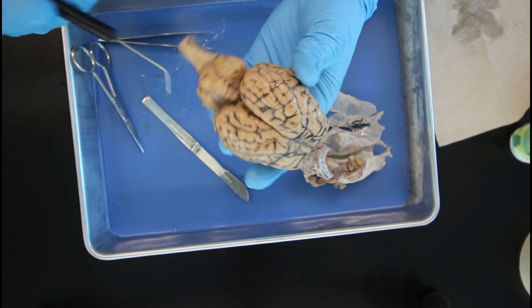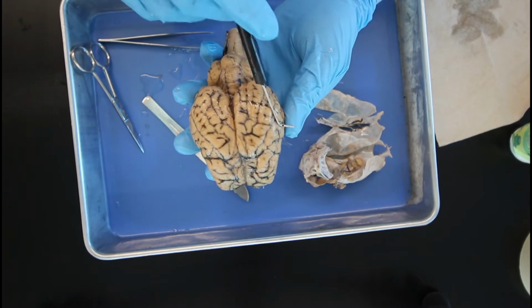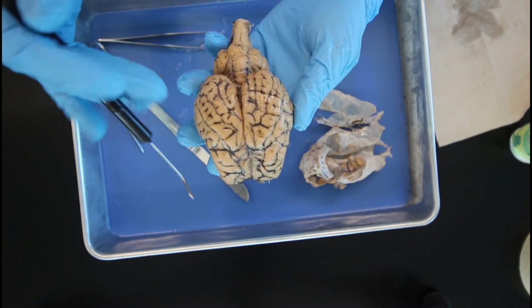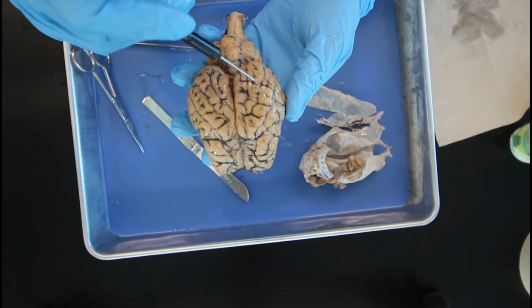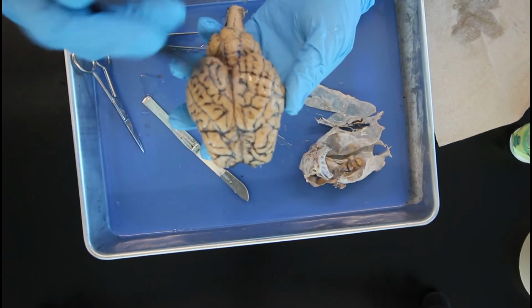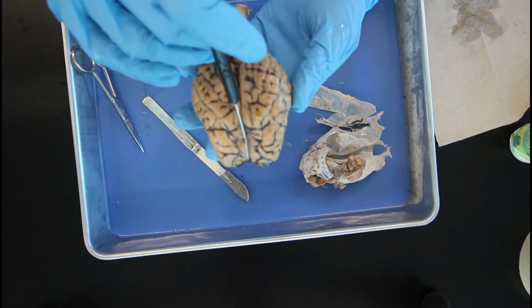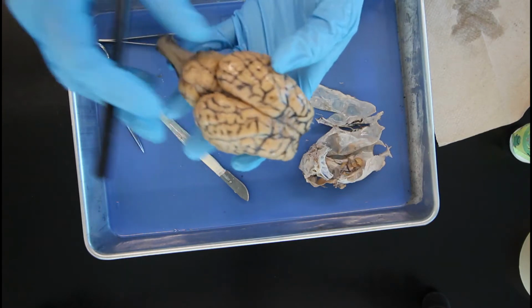So you can see here we have the brain that's split into 2 hemispheres. We have our left and our right. And for y'all that don't know, the right part of the brain controls the majority of your left side of the body, and your left part of your brain controls the majority of your right part of your body, and they intertwine up in the center, which we'll get more in depth with.